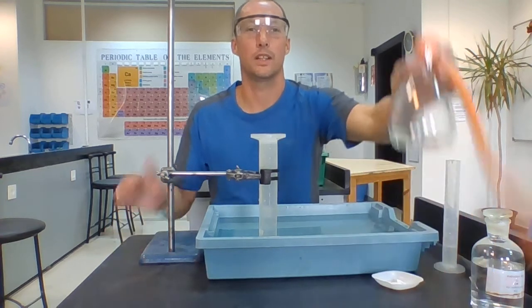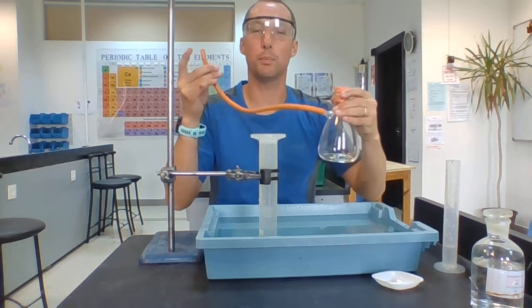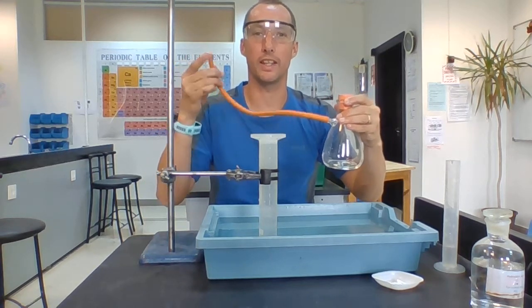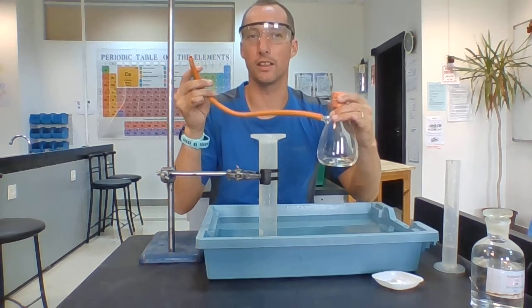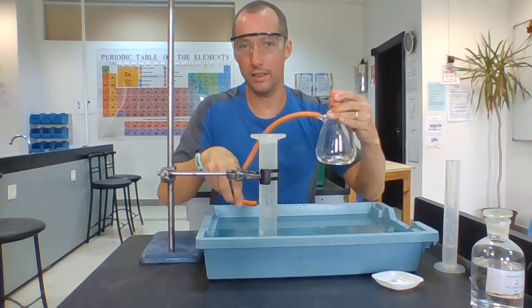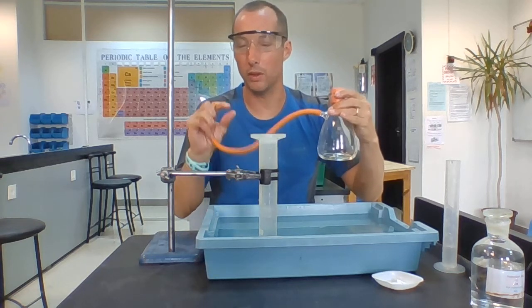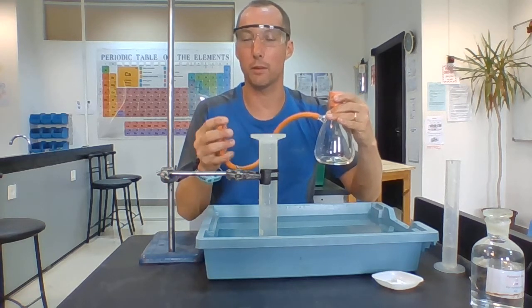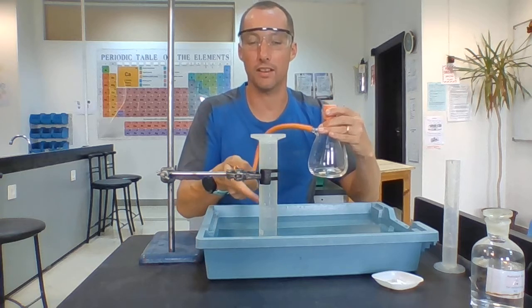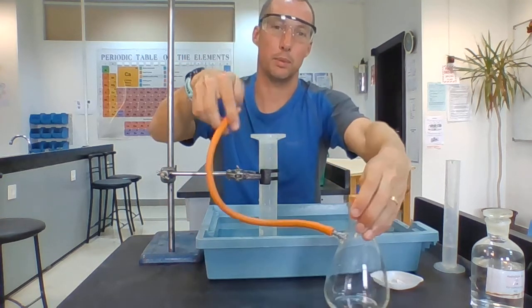So I'm going to use the same sidearm flask as I was earlier. When we produce the gas, it's going to bubble out the end of here. Notice I've not got it connected to the gas syringe anymore. I'm going to put this pipe underneath the measuring cylinder because there's a little gap between the bottom of the tray and the measuring cylinder, and the bubbles of carbon dioxide gas are going to come up and fill up the measuring cylinder.